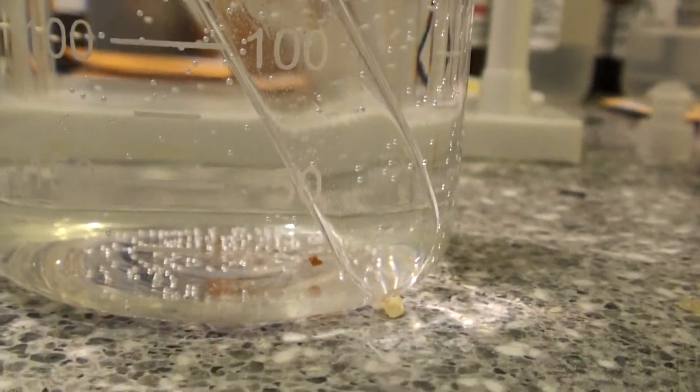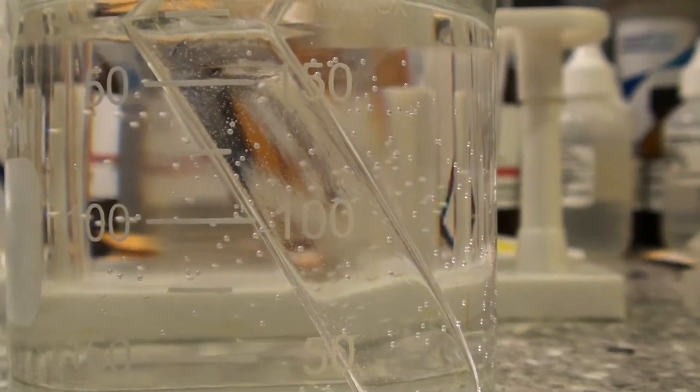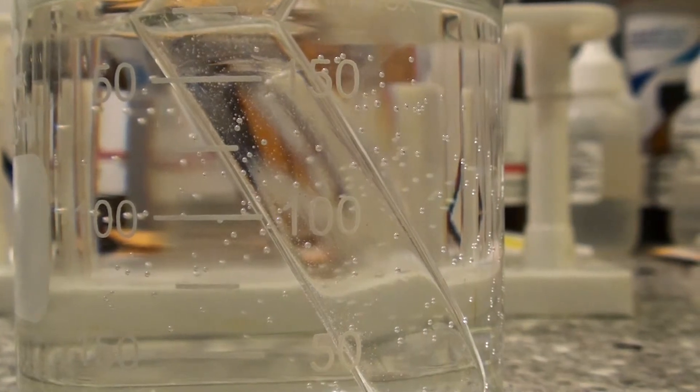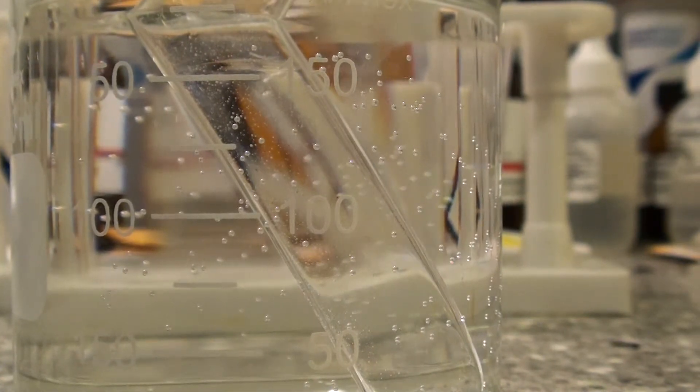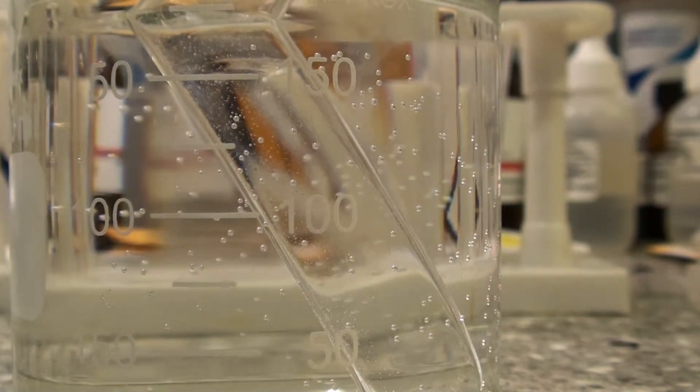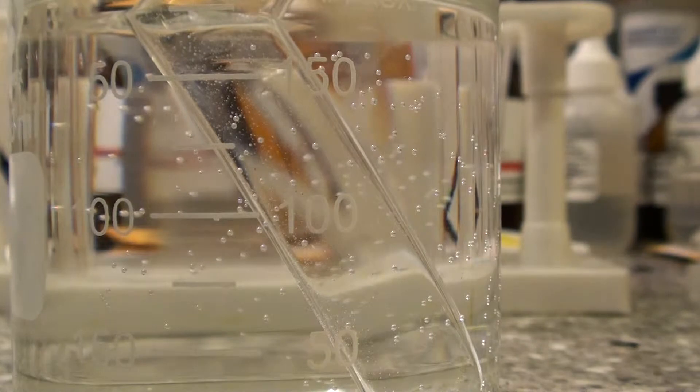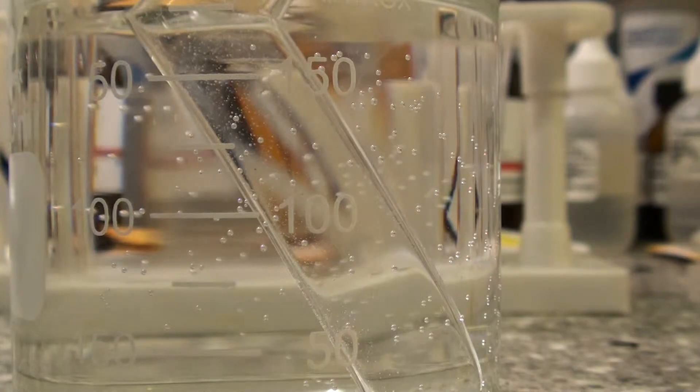But, this gives this cool snowball-ish effect. As the crystals fall they will expand. Anyway, our chemical, Ammonium Chloride, right here. Basically, this chemical will form a supersaturated solution and rebuild a crystal. So, that's what I'm going to show you today.